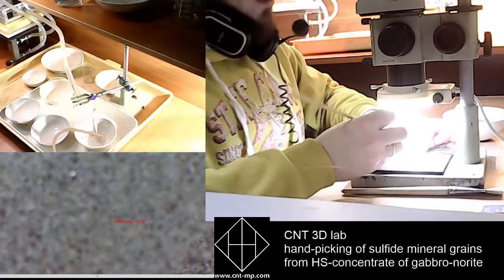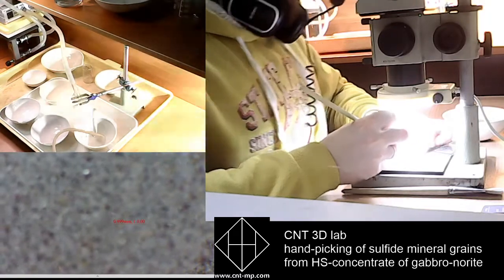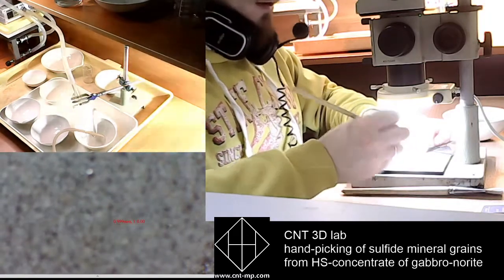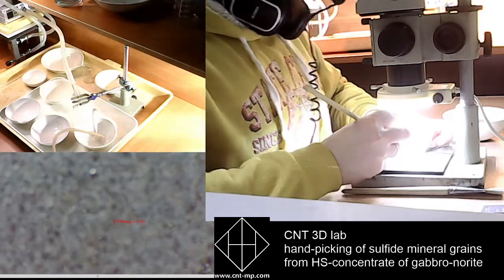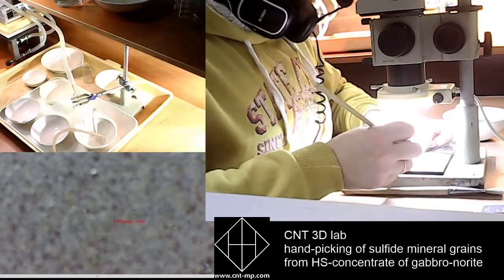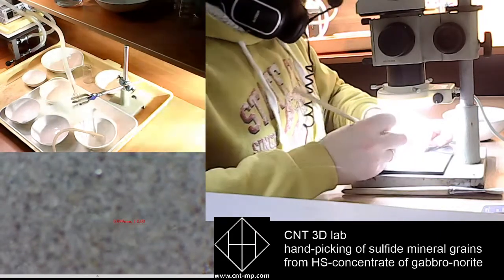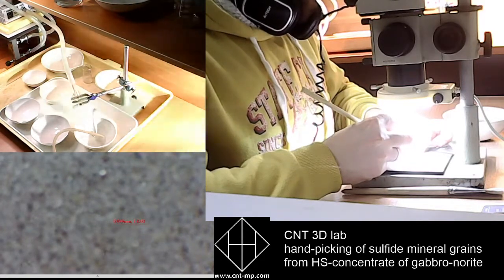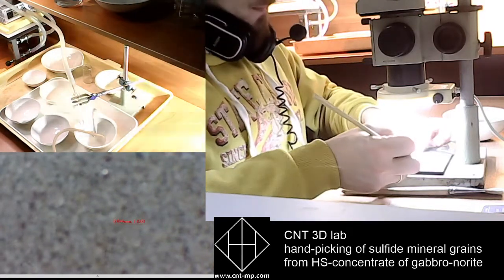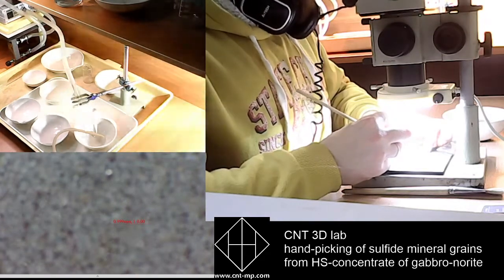I've already collected about 15 grains of monomineral sulfide grains. Most of them are chalcopyrite, but there are still many grains with a bronze, shiny color.